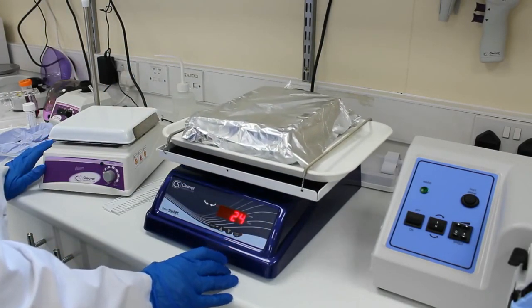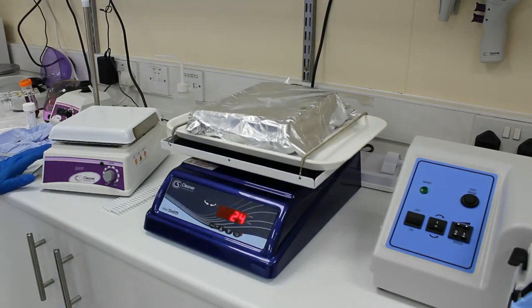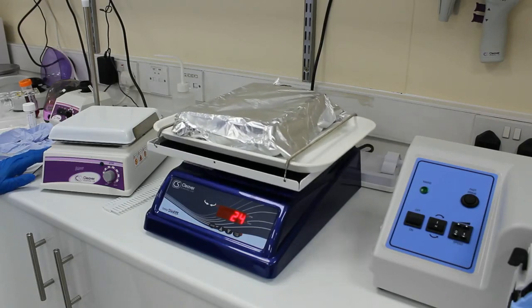And we're going to set our orbital shaker at a very low RPM just for a slight mixing of the liquid on top of the gel.